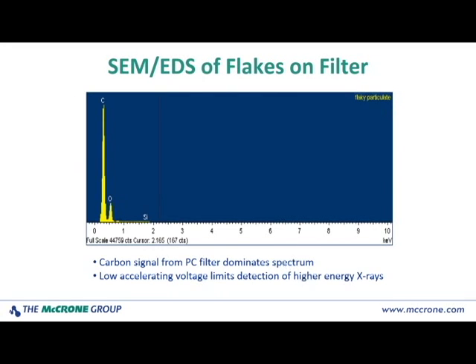So here we have a typical SEM EDS spectrum taken from delamination flakes on a polycarbonate filter. So a liquid product was filtered onto the polycarbonate filter. A section of that filter was then put onto a substrate for SEM analysis. So you can see that in this spectrum, the dominant peak really is the carbon from the polycarbonate filter. You have an oxygen peak, and you have some evidence that there's silicon present. And as I mentioned also, the low accelerating voltage means that you limit generation of higher energy X-rays. So we're cutting off somewhere below 2 keV here.